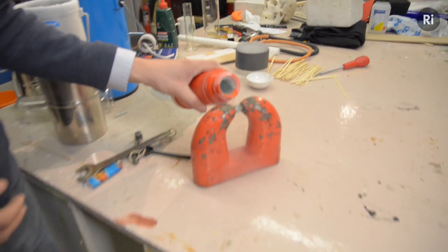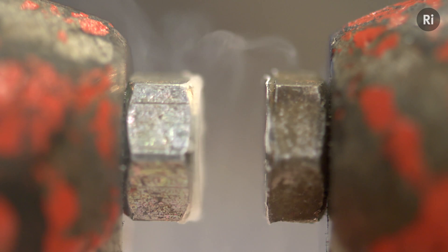So I'll keep on pouring this in, and we can keep on looking at it. Now normally when the oxygen is just sitting in the flask or in the air, all those tiny little magnets are pointing in random directions, basically. So they all cancel out, so there's no net macroscopic magnetic field.